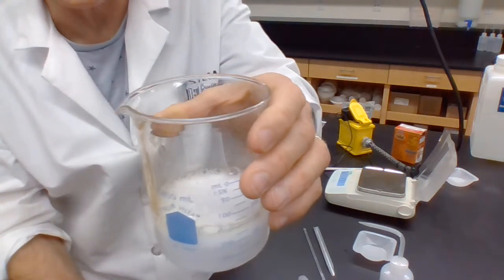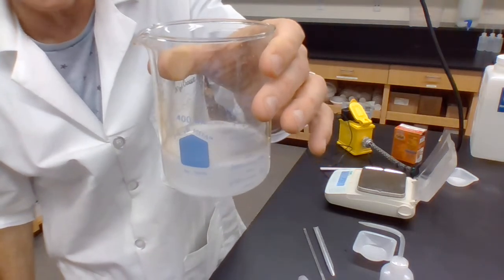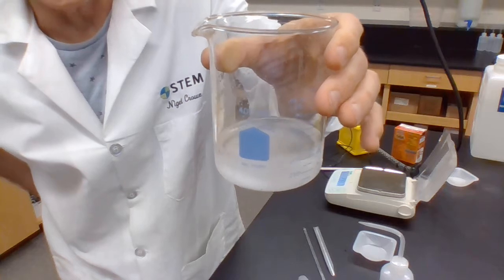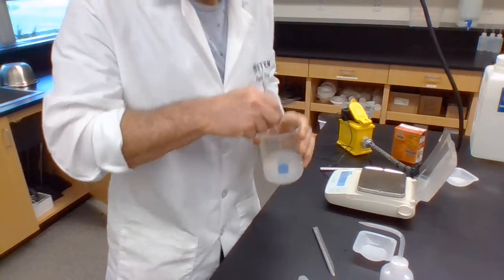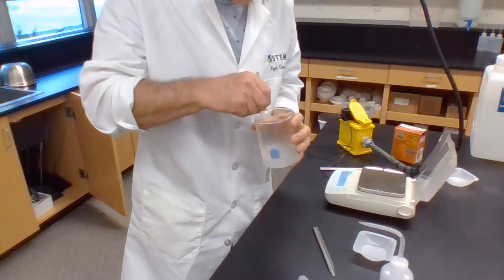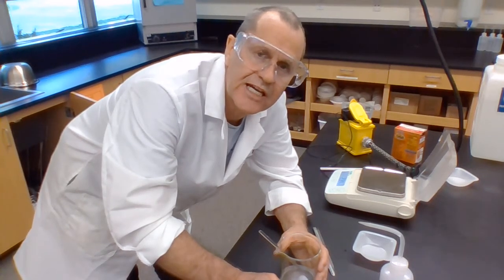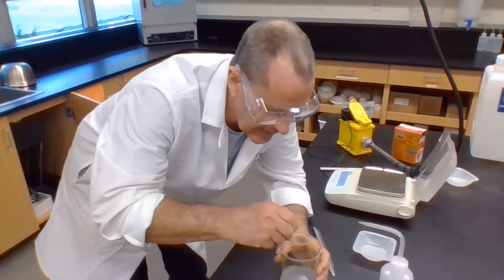And this is what an antacid does when you swallow an antacid tablet and it goes down into your stomach, because your stomach is full of all sorts of exciting little bits of acid. And therefore, it will react very well with the alkaline sodium hydrogen carbonate. And I want all of this to react. And of course, it's not all going to be reacting. And the reason it's not all going to be reacting is I didn't carefully measure out 3 times as many moles of sodium hydrogen carbonate as of citric acid. In fact, I didn't really take care of what I was measuring out at all. I just did measure it.